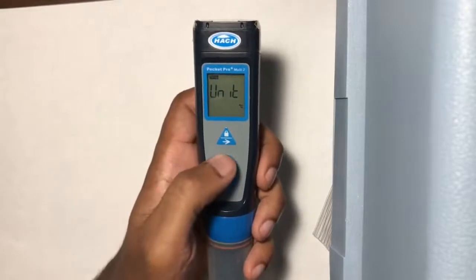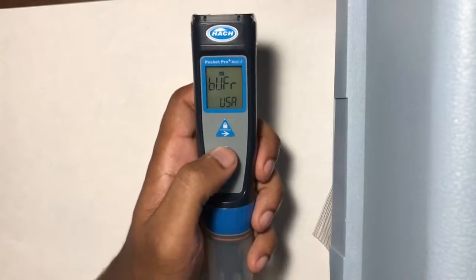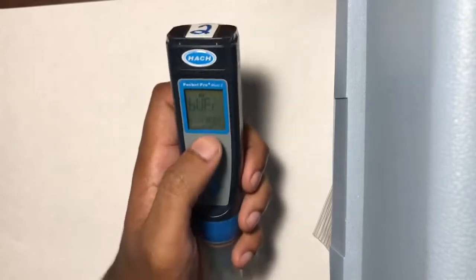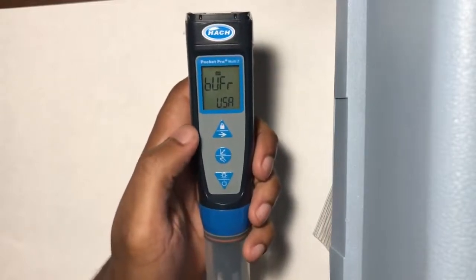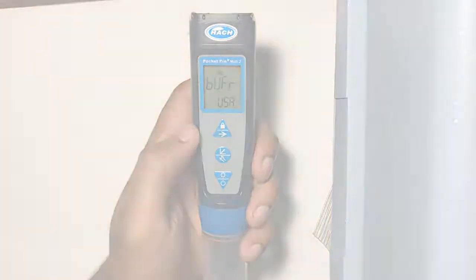If you tap the middle button again, it will shift to the next changeable parameter, which is buffer. Buffer changes the scale that acidity is measured in. This would be set to USA, to display the correct reading that we want, and to ensure that the calibration for pH happens correctly. For your knowledge, I'll quickly go through the rest of the parameters.